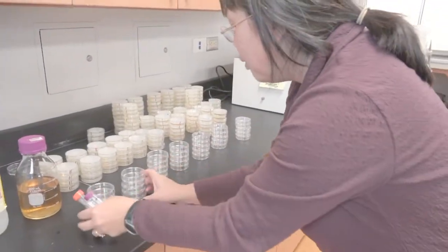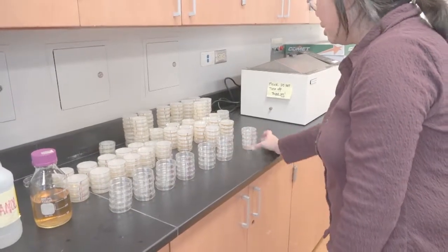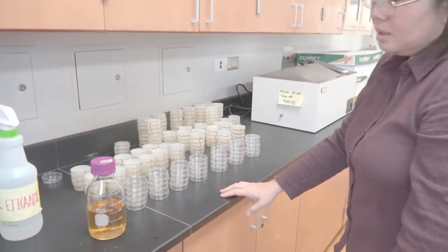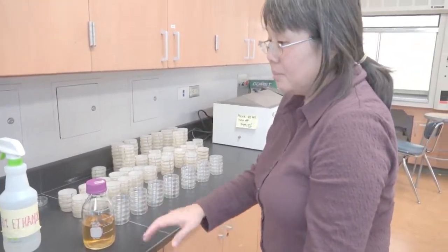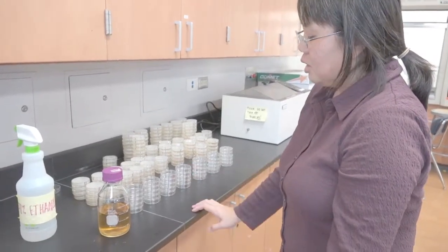Notice I have more than one sleeve ready to go here. I have about 300 mils of LB agar, and that will pour about 30 plates. That's a little bit more than a sleeve, depending on how thick or thin you pour your agar.